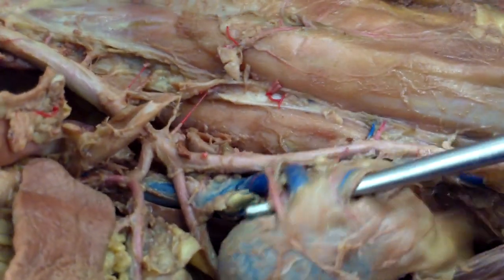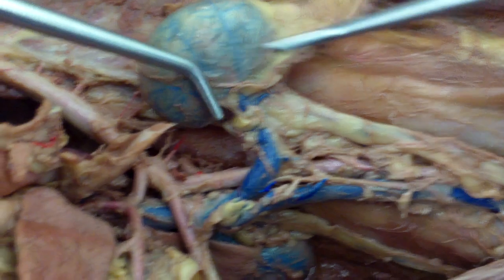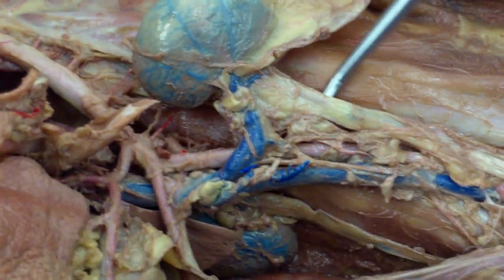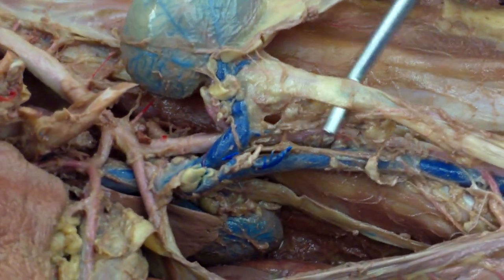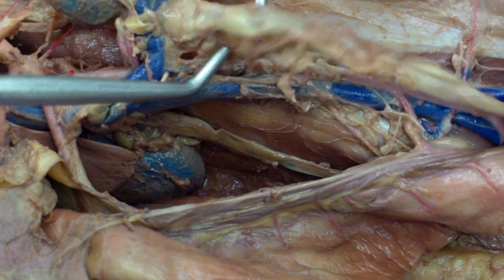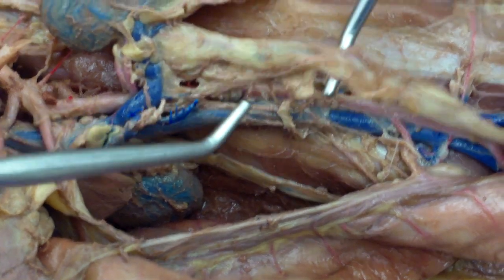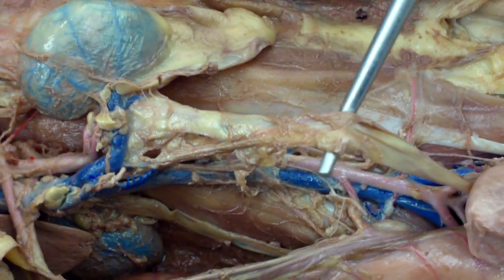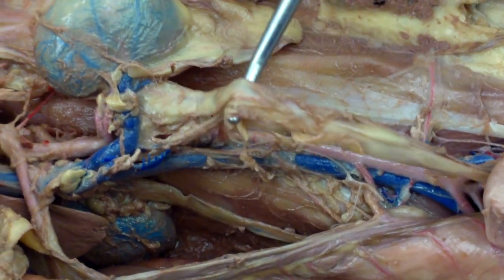Here we'll flip the kidney back. And then off of that you have your testicular artery, which follows along the ureter — it's very close in there with the ureter.